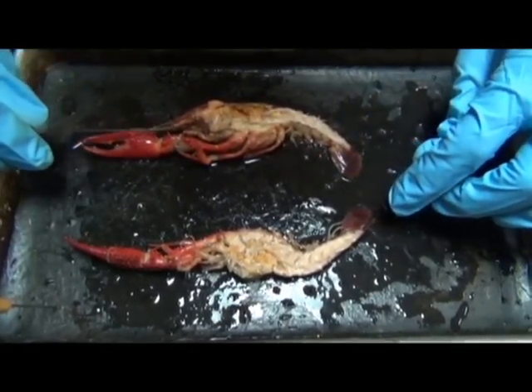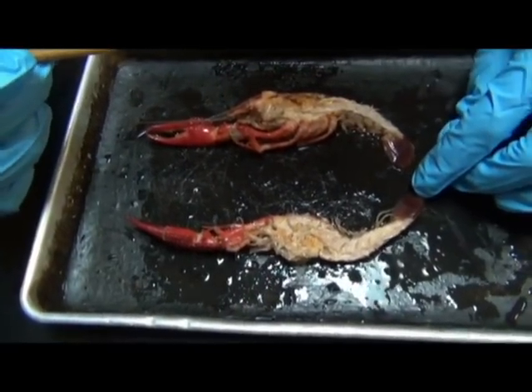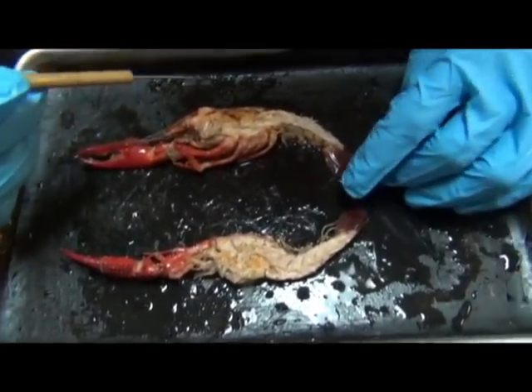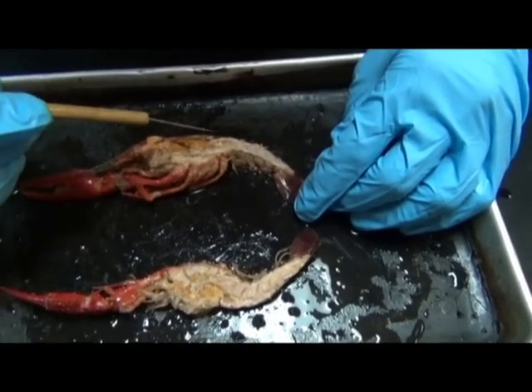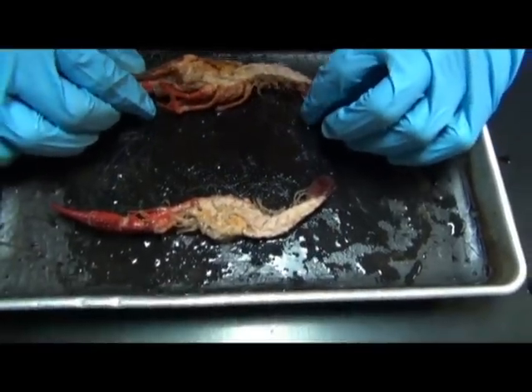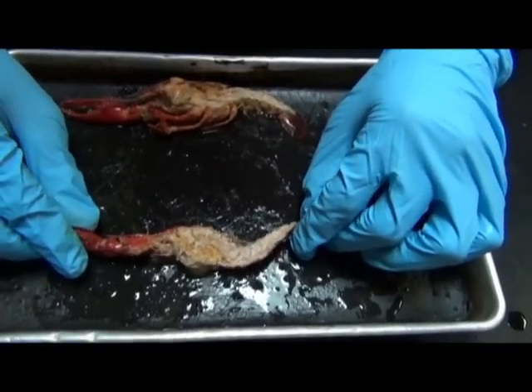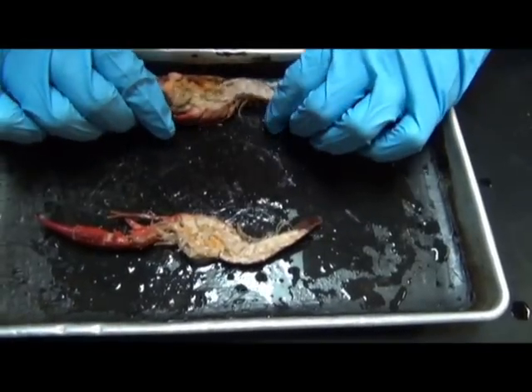But for the purposes of this course, just focus more on those two interesting qualities: the stomach behind the face and the major nerve cord on the belly side instead of the back. Now, I say that those are unique because I'm listing characters that are unique compared to chordates. Okay.